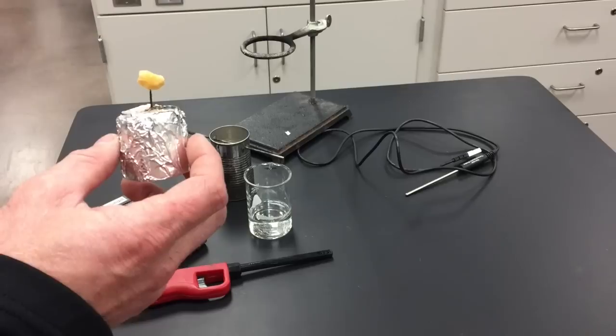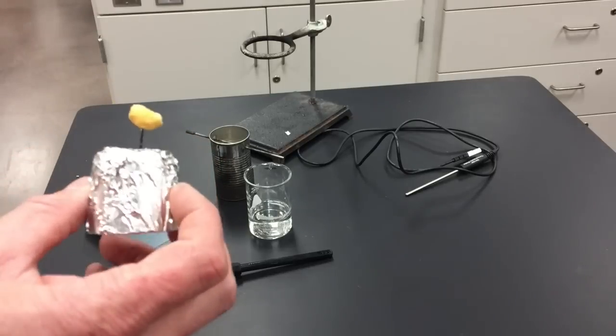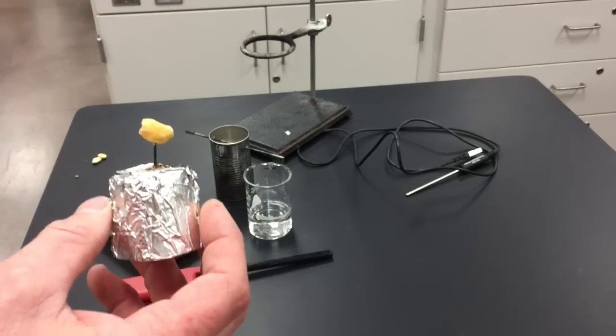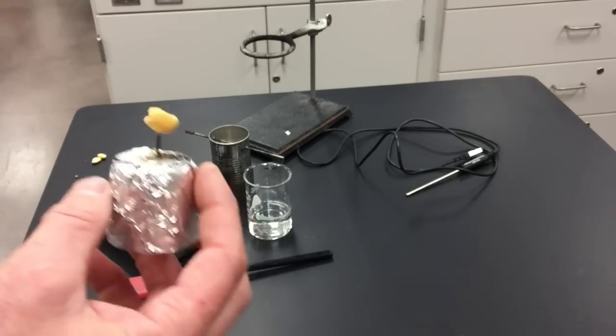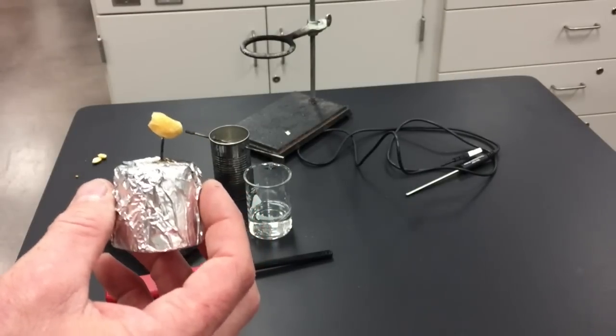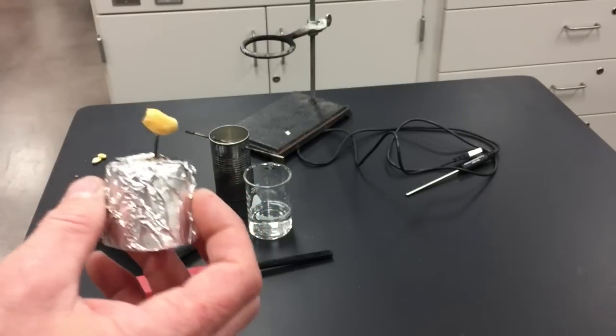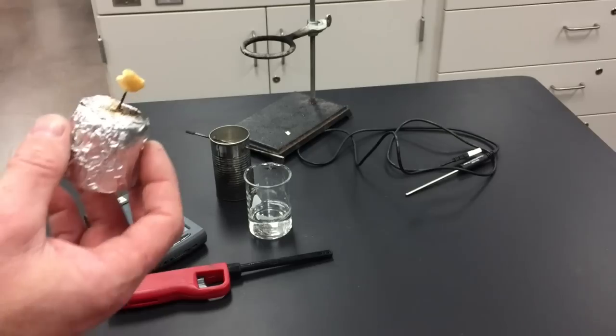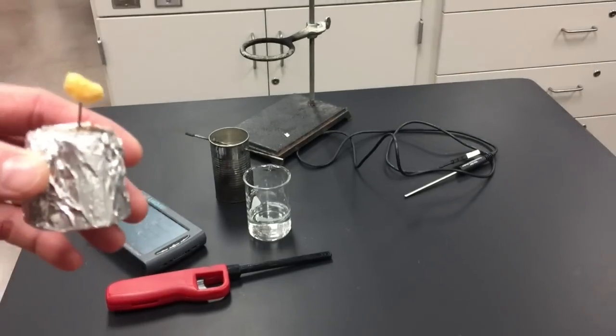I want to know how much of the food was burned away. If I know what this weighs before and after I burn it, then I can get the difference in the weight, which is how much food was actually burned. So I'll just put this on the scale.